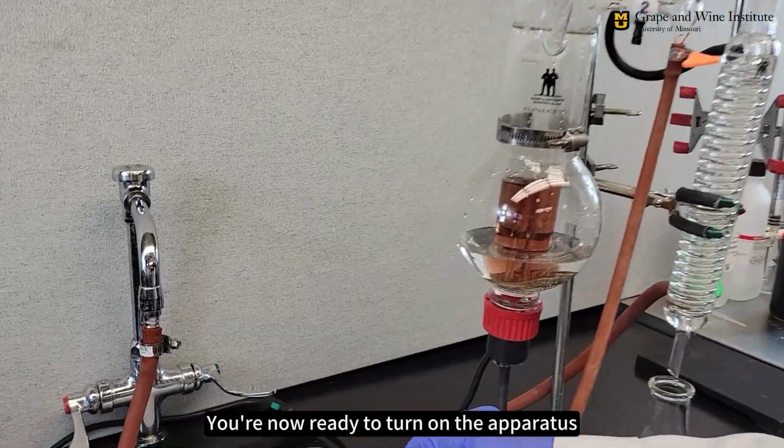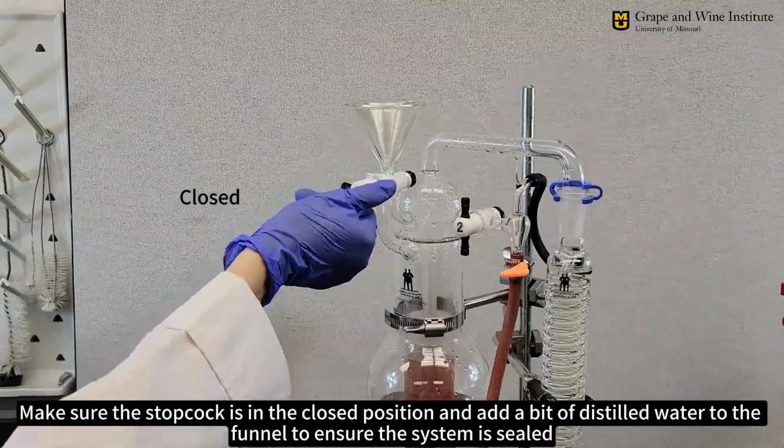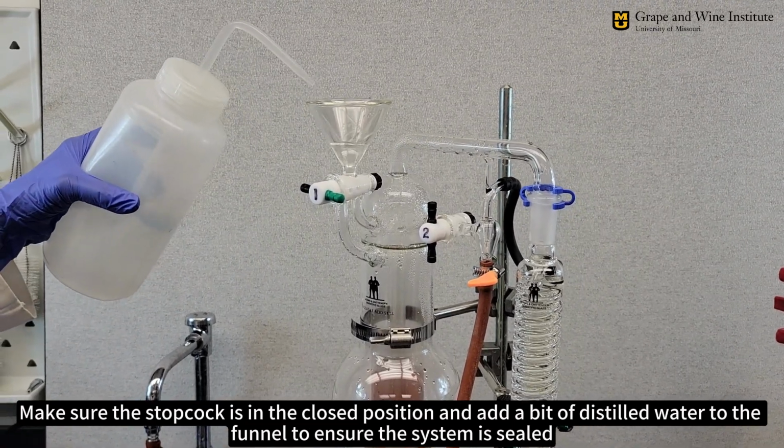You're now ready to turn on the apparatus. Make sure the stopcock is in the closed position and add a bit of distilled water to the funnel to ensure the system is sealed.